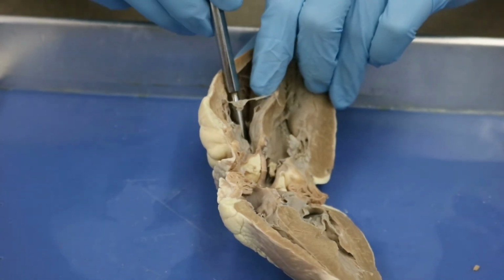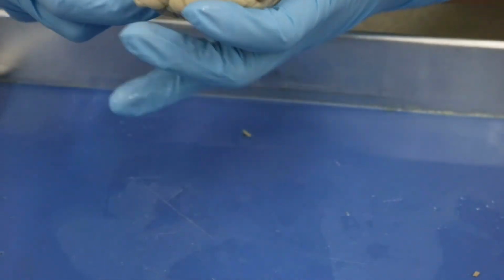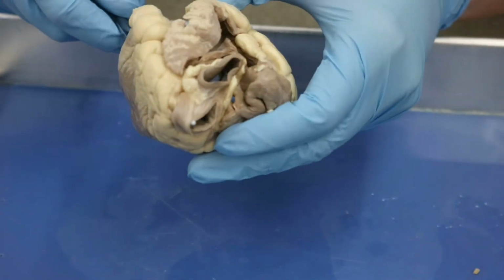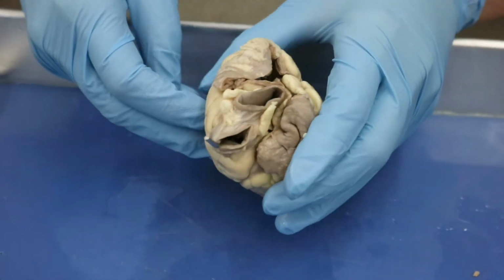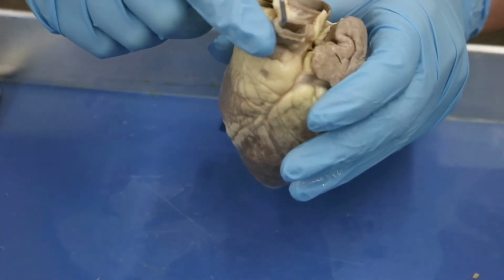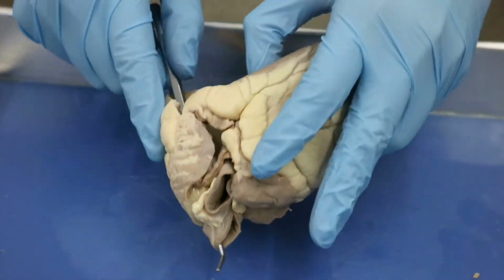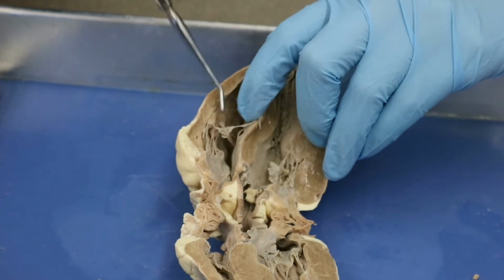So when we put our probe through, we're going to see that, well, you can see it's poking right there. And if I can get it to angle just right, I'm not sure I'm going to be able to get it to angle right. There we go. Okay, so we went from the right ventricle out through this vessel, confirming that we were correct before, since we are talking about right-handed things here. We were correct before that this is the pulmonary trunk, okay? Because the pulmonary trunk, of course, is coming off of the right ventricle, okay?